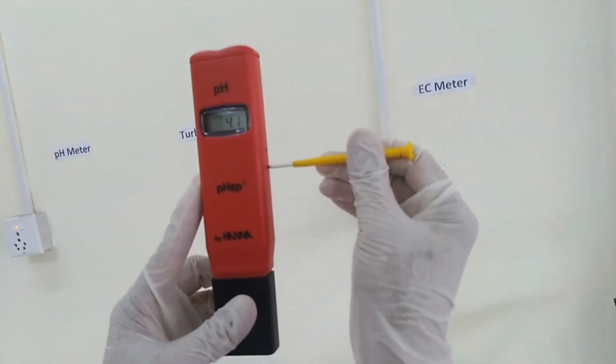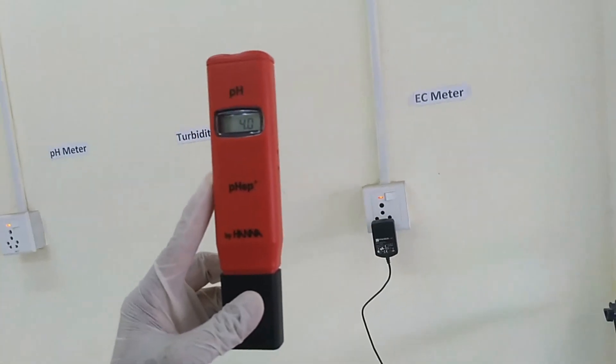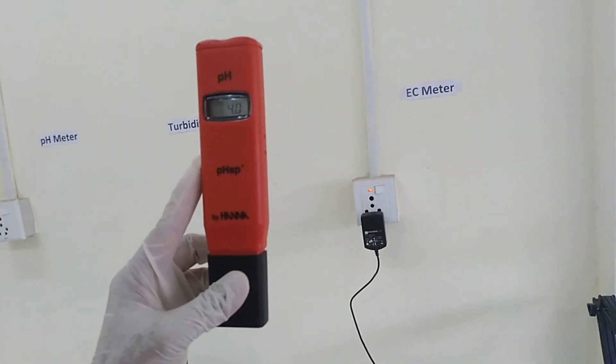Now instrument calibration is completed and the instrument is ready for measurement. We can repeat the calibration again for more accurate result.